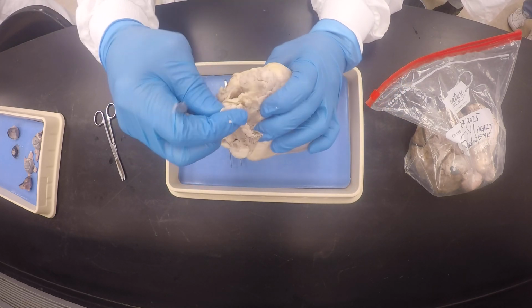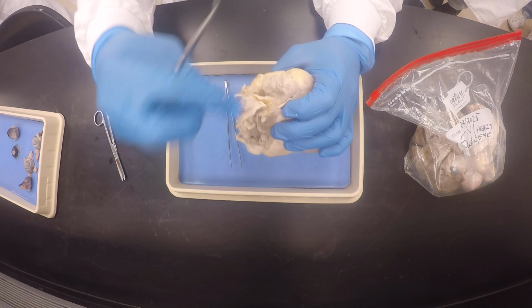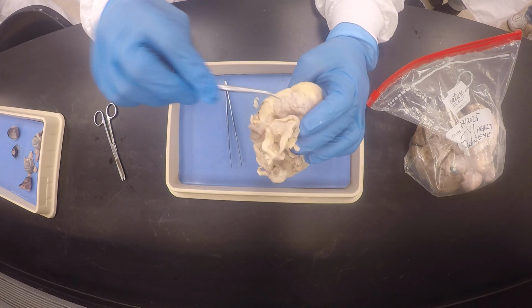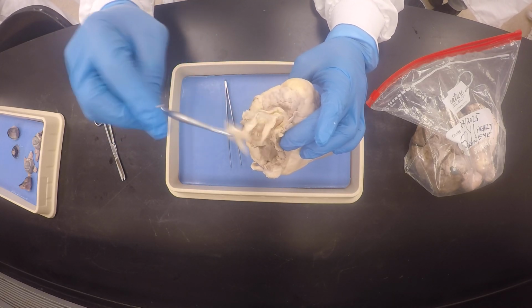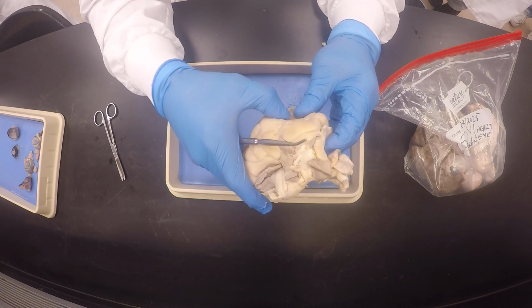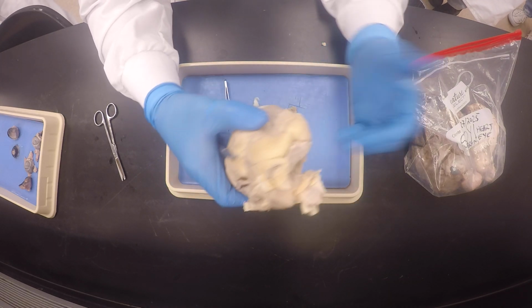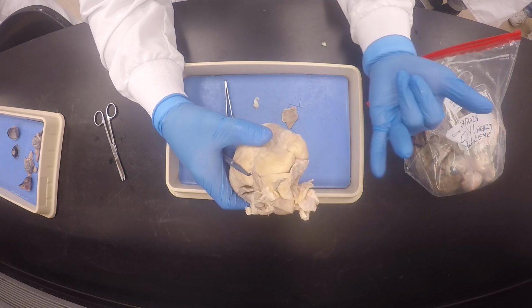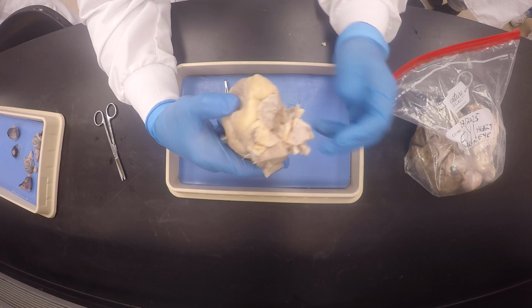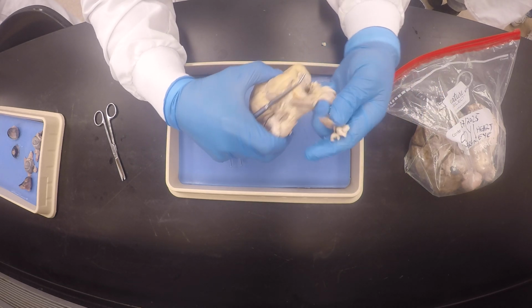And sometimes you might see the superior vena cava, like here. The superior vena cava goes into the right atrium. Okay? But usually, if I'm pointing towards the right auricle and ask what's that major blood vessel, you could say superior vena cava, you could say vena cava, or even inferior vena cava, I don't mind. Usually, you never see the inferior vena cava. It's always cut. Okay, my good friends?